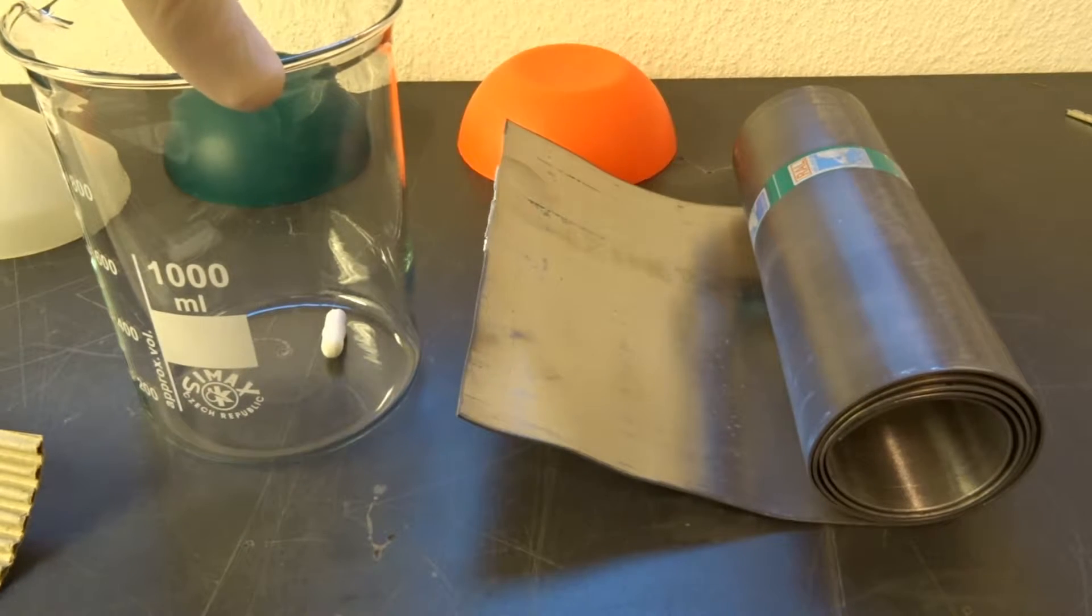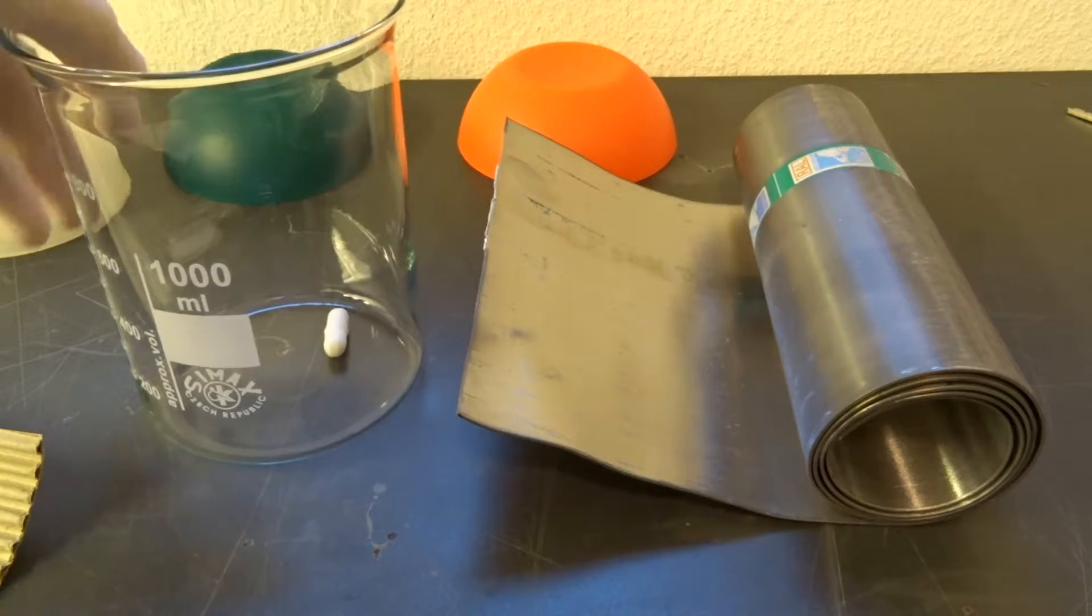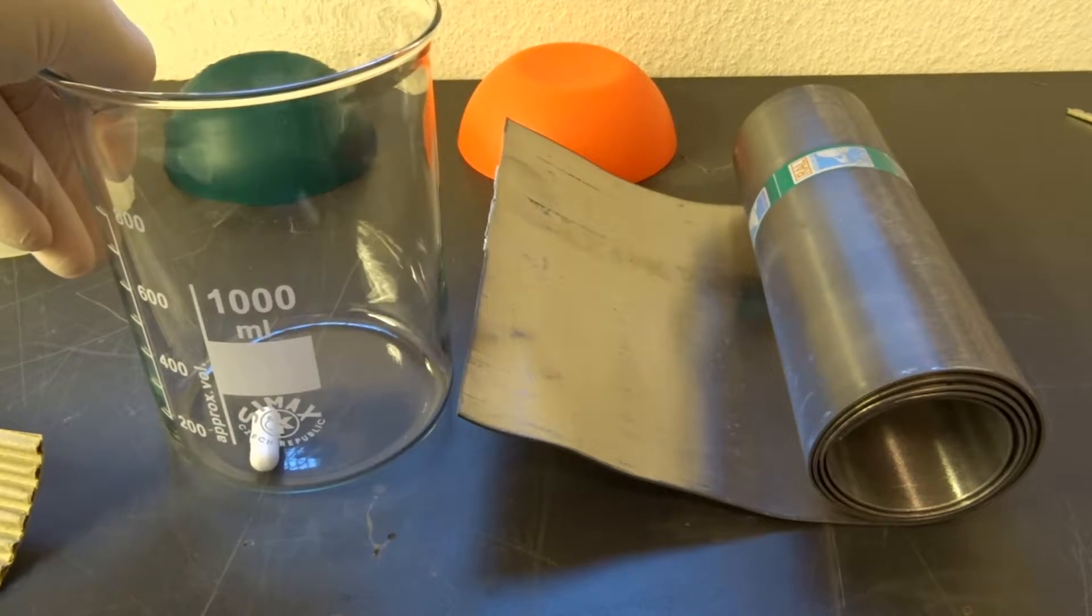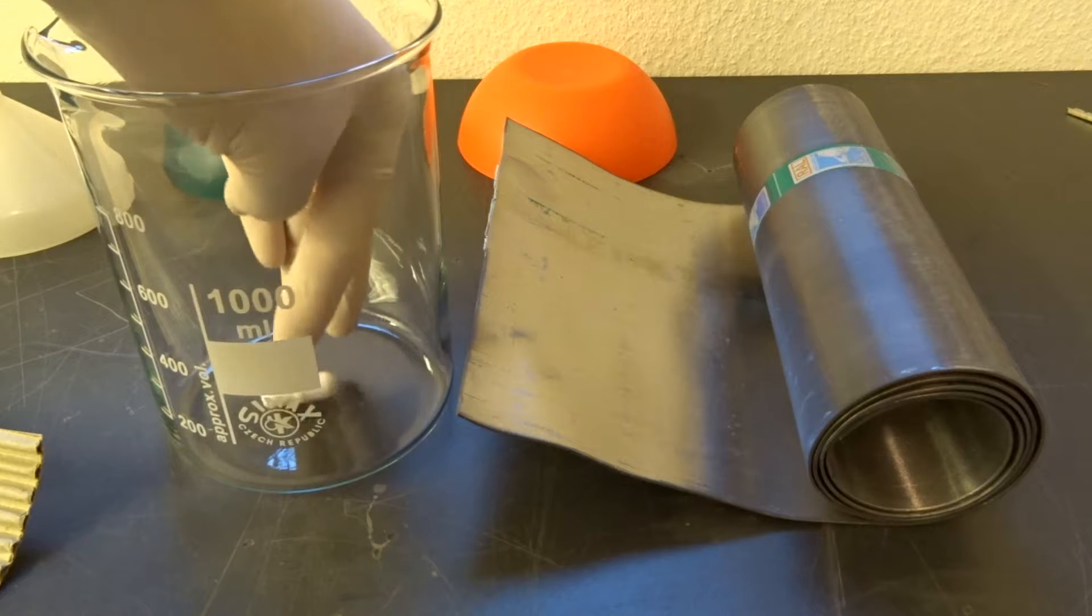Today I want to make manganese dioxide by electrolysis in this large beaker from manganese sulfate I've bought as a fertilizer.